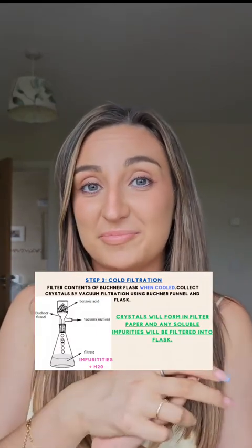in your filter paper. And then your last step of recrystallization is drying. You can wash your crystals now with deionized water and this will remove any remaining impurities. Transfer those crystals that you have made onto a clock glass and then you can put it in the oven for drying. Remember here that the dryness is essential before you do the melting point.